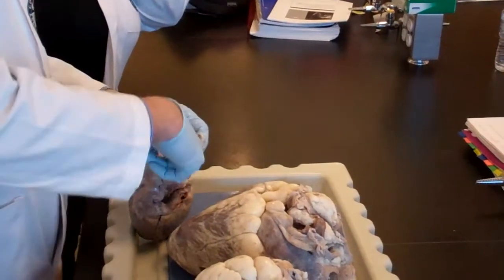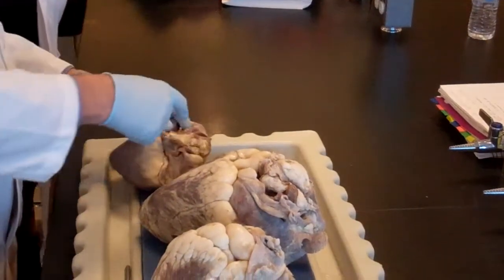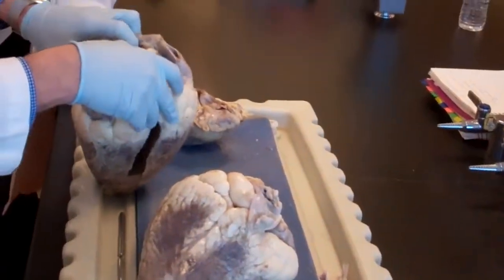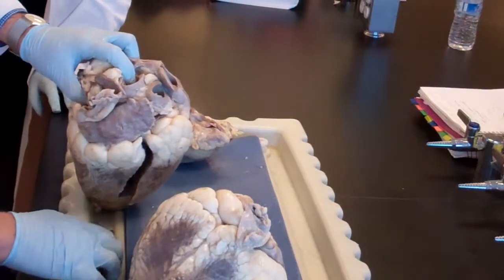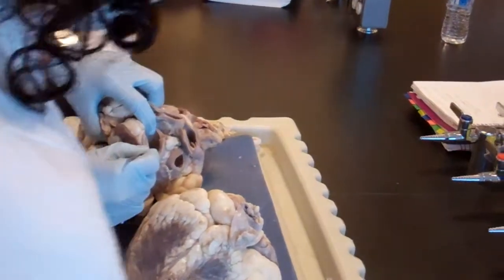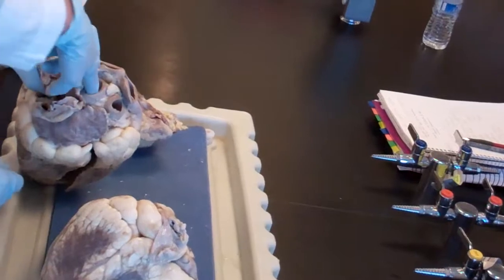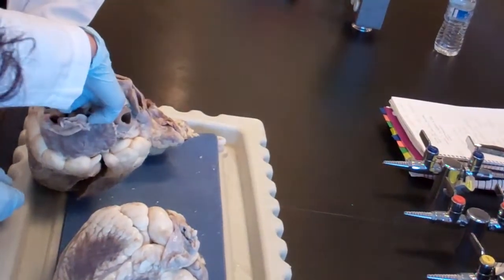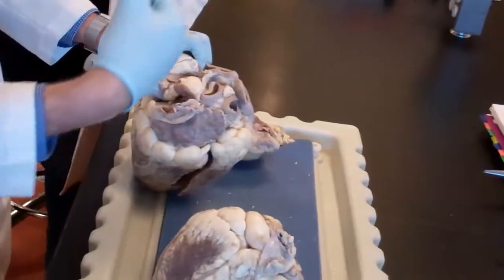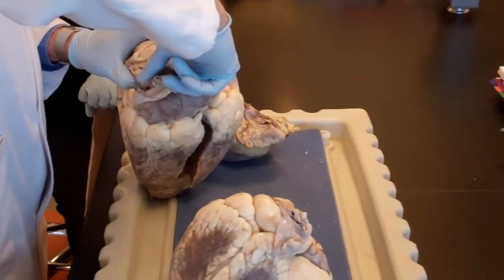That's the aortic arch, technically. Okay? And if you go further to the aortic arch, here it's easier. If you go looky, you see the aortic, no, I'll go this way. Aortic semilunar valve right there. Can you see it? I have another suggestion. Put your fingers there, please. You see it's being held, yes? Okay. Because you cannot go this way. The blood goes to the other side. Okay? So whenever you go in there, she lied to you.